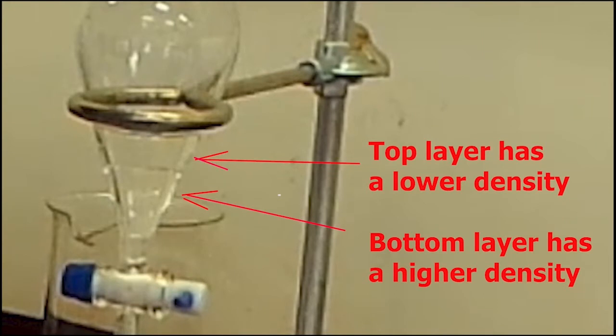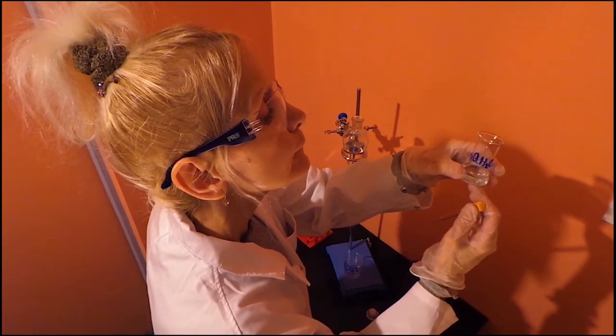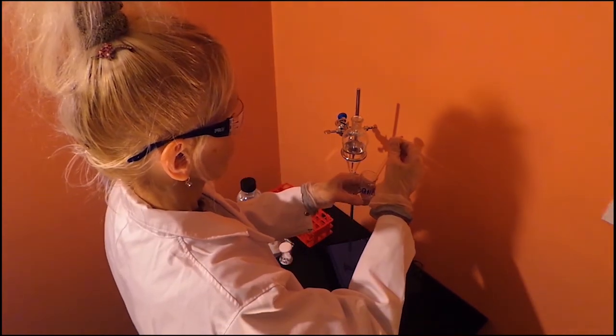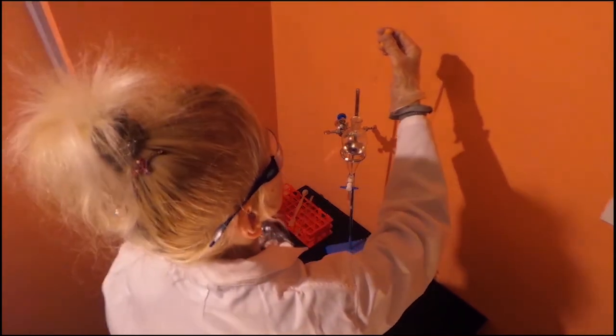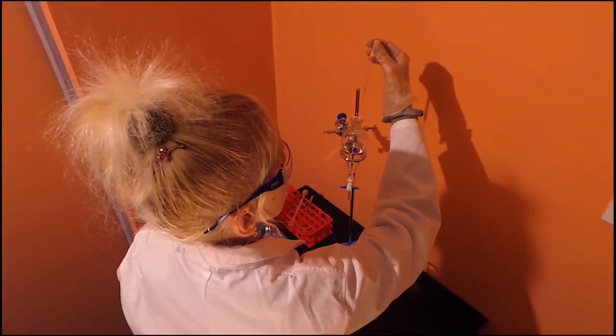If you are not sure whether the aqueous layer is above or below the organic layer, add a few drops of deionized water. The water droplets may enter either the top layer or the bottom layer. In any case, they shall enter the aqueous layer.